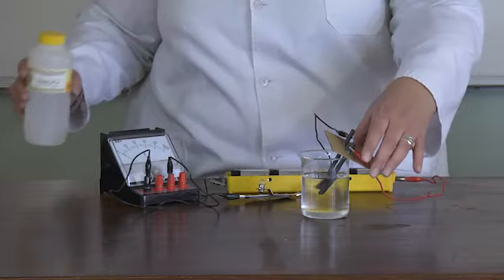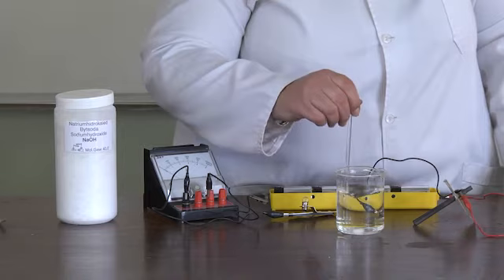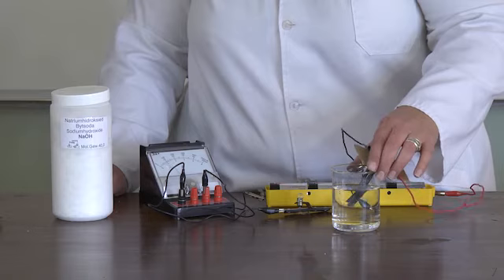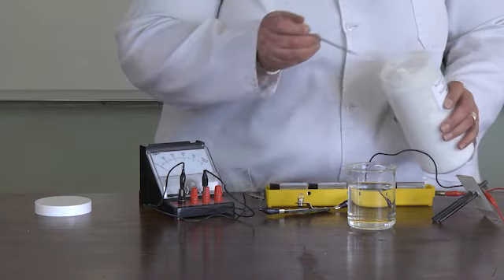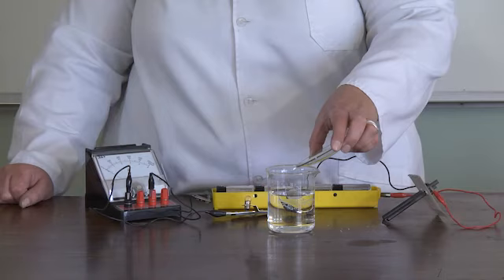Clean the electrodes. Add some sodium hydroxide to distilled water and stir until it dissolves completely. Place the electrodes in the solution and observe what happens. The ammeter shows that a current is flowing. Add some more sodium hydroxide and stir again until it dissolves — the current flows stronger and the light bulb shines brighter.